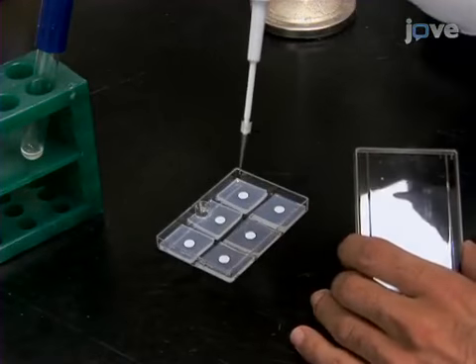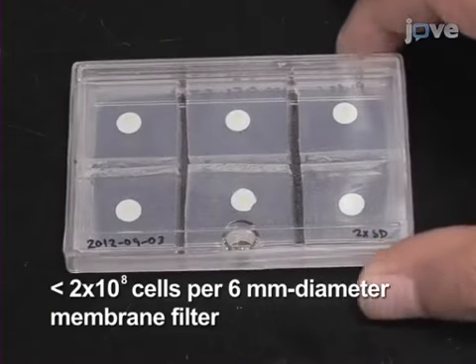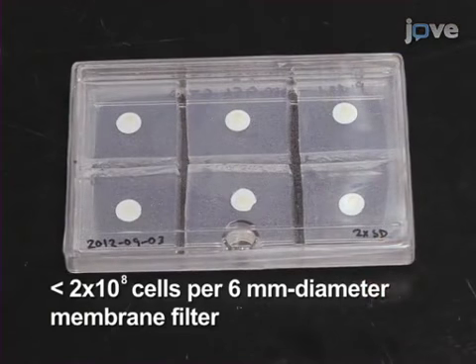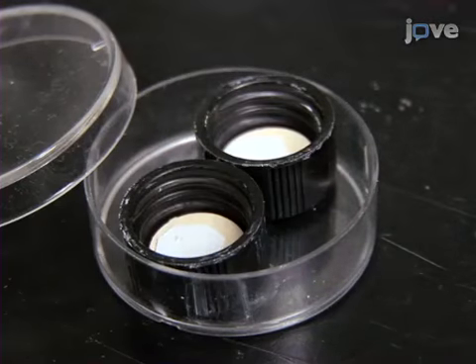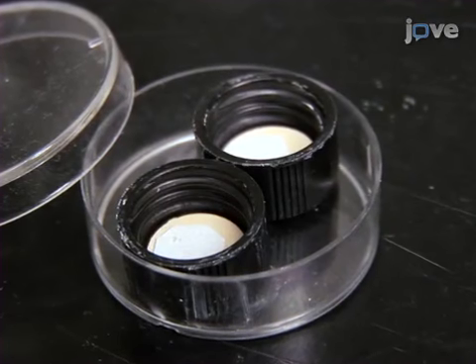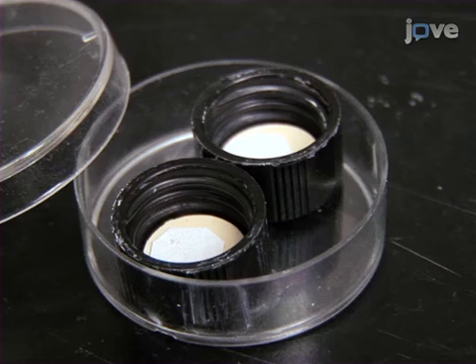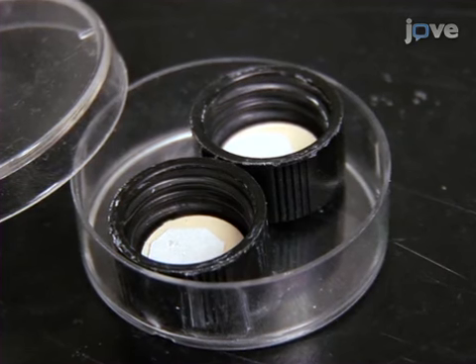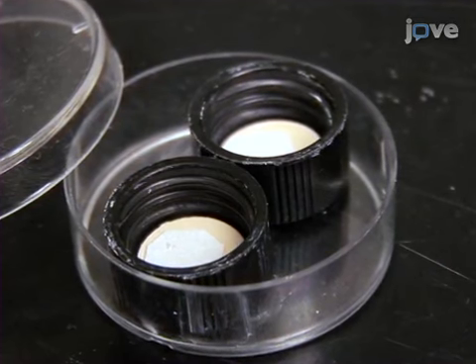To begin this procedure, grow yeast communities on a membrane filter. This protocol corresponds to a typical community of less than 2 × 10⁸ cells on a 6 mm diameter membrane filter. Next, in a -20°C freezer to preserve a greater degree of fluorescence, use a piece of Whatman 541 filter paper to cover the bottom of a 1 cm diameter well. This filter paper is used as a carrier to transfer the community in later stages.